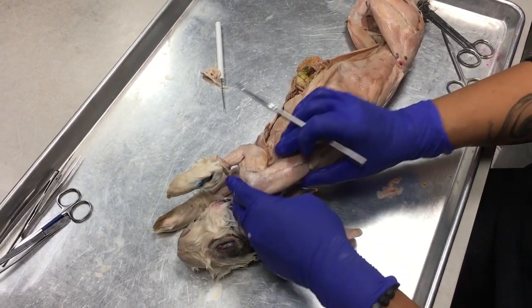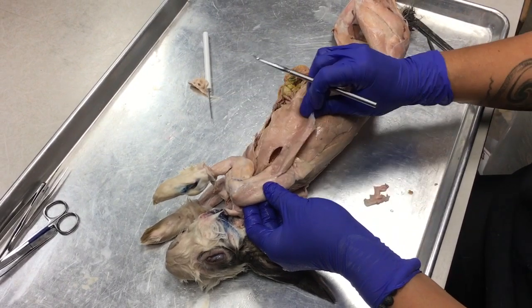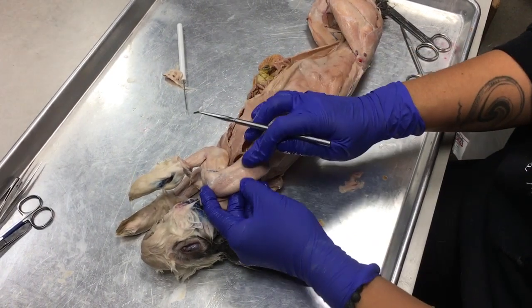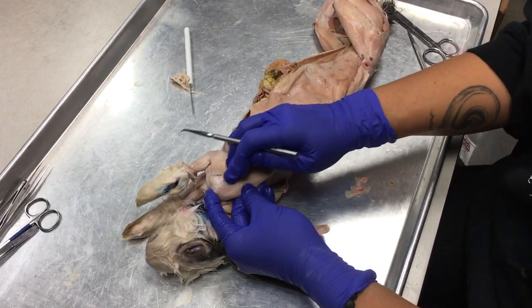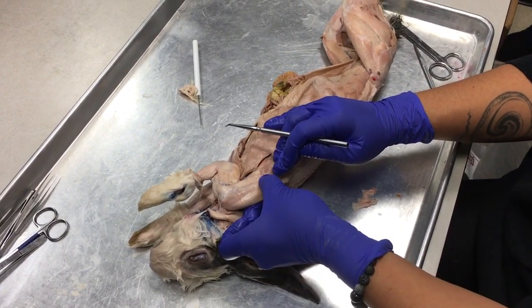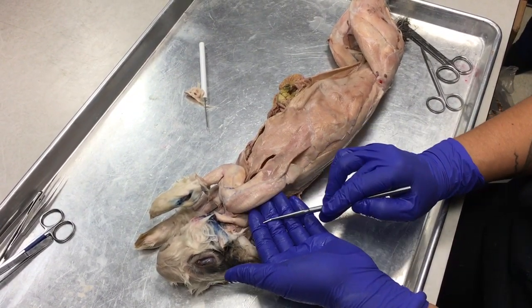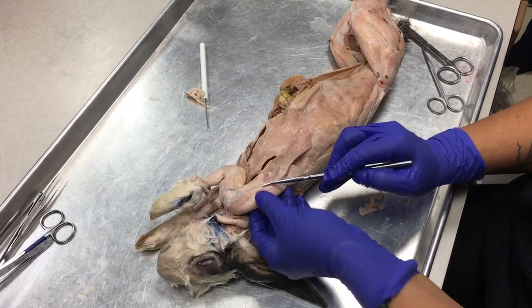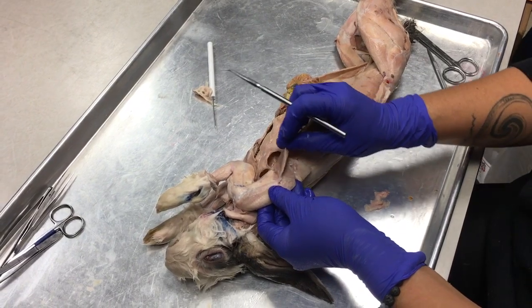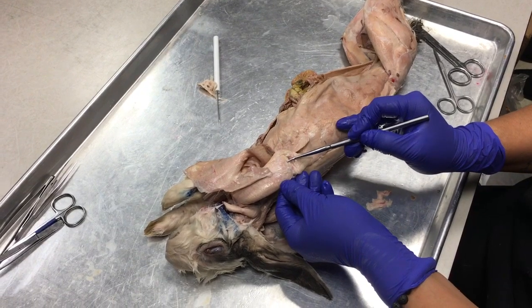So what I want you guys to appreciate, here's your big shoulder blade. And if I lift up the spinodeltoid here and some of the trapezius muscles that I can't identify, what we'll notice is that in the middle of this shoulder blade, you can feel the spine of the scapula. So there's a group of muscles that sits atop or dorsal to the spine of the scapula. There's a group of muscles that sits below or ventral to the spine of the scapula. And then there's a little wedge-shaped muscle in the posterior corner.